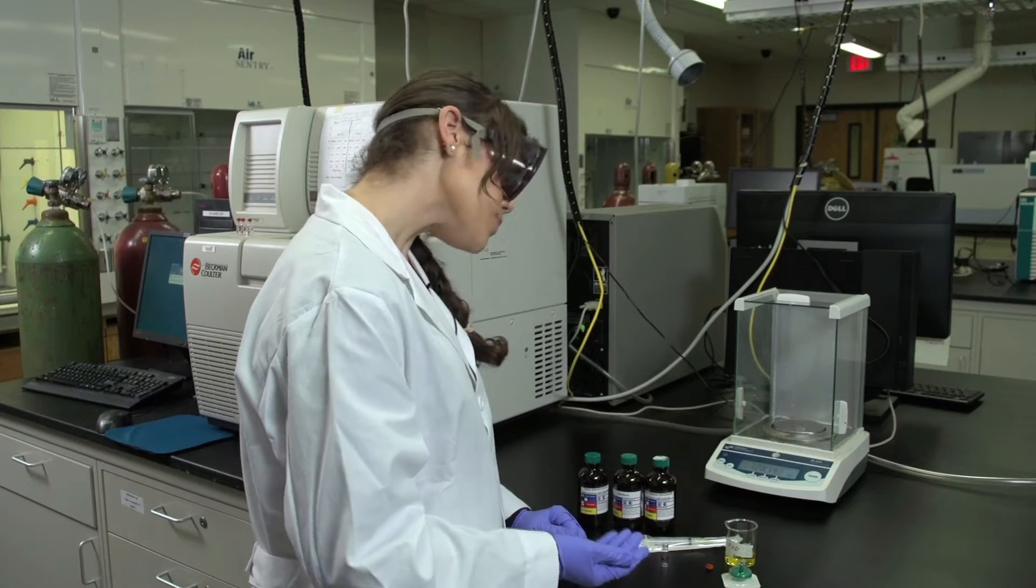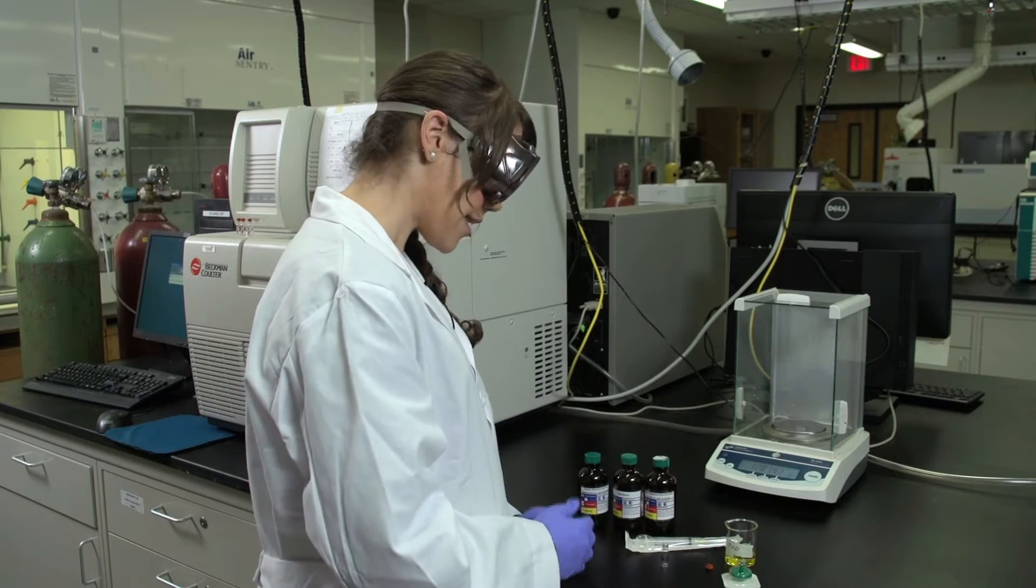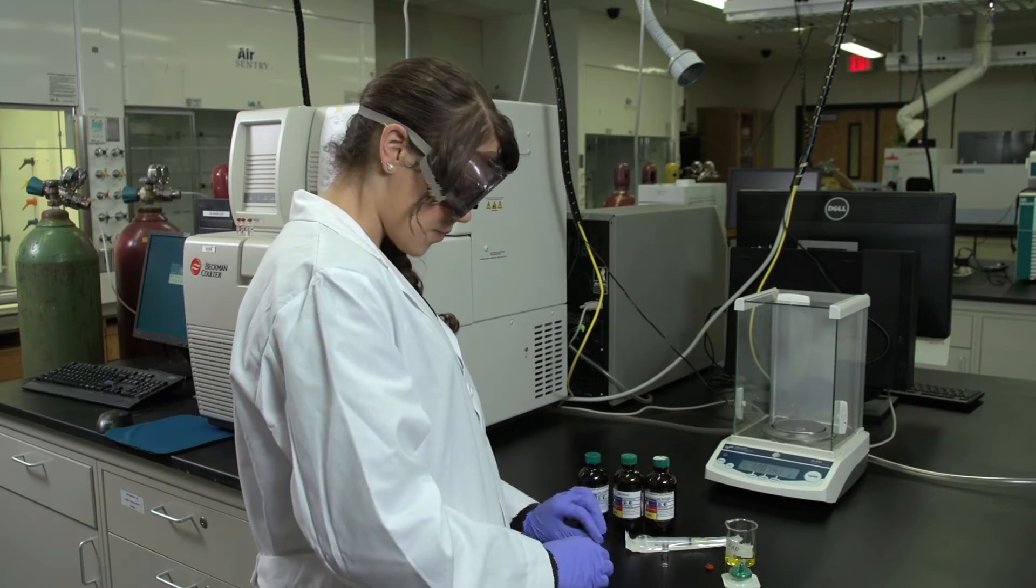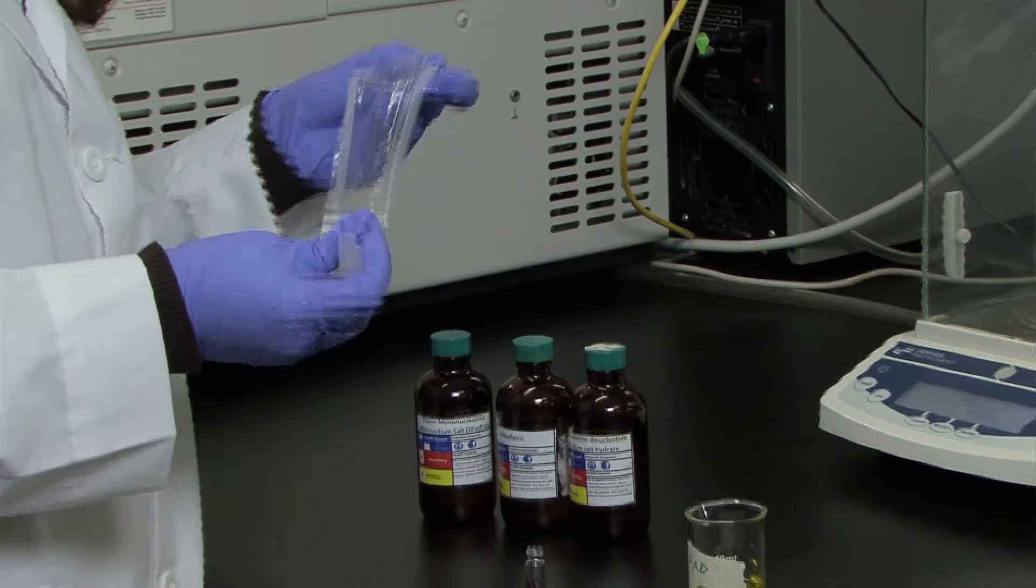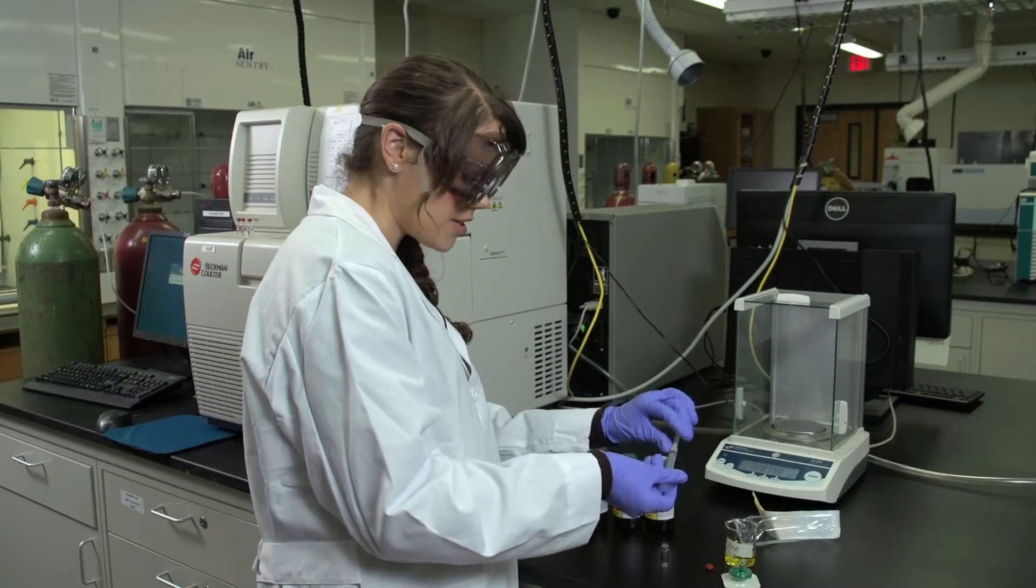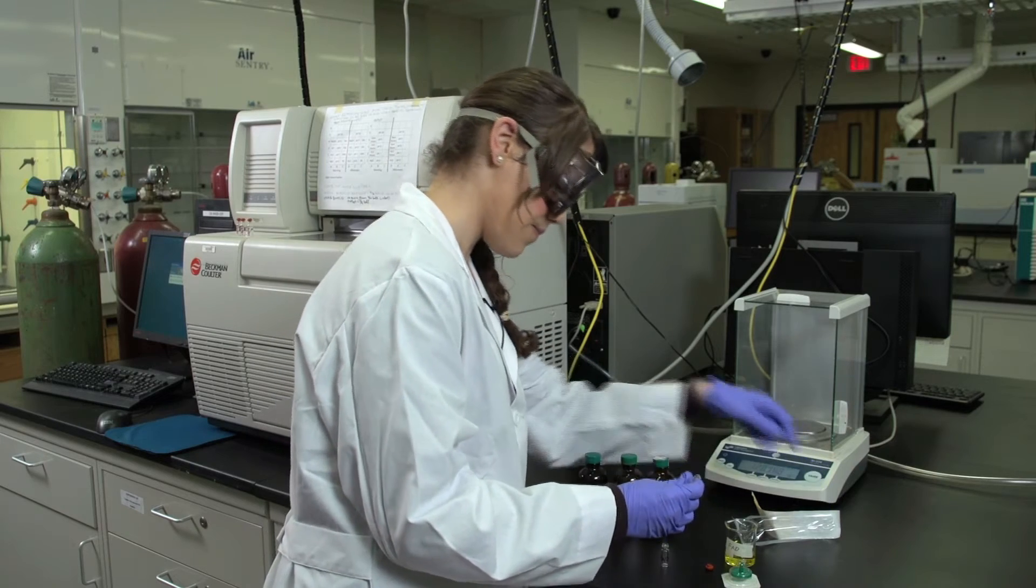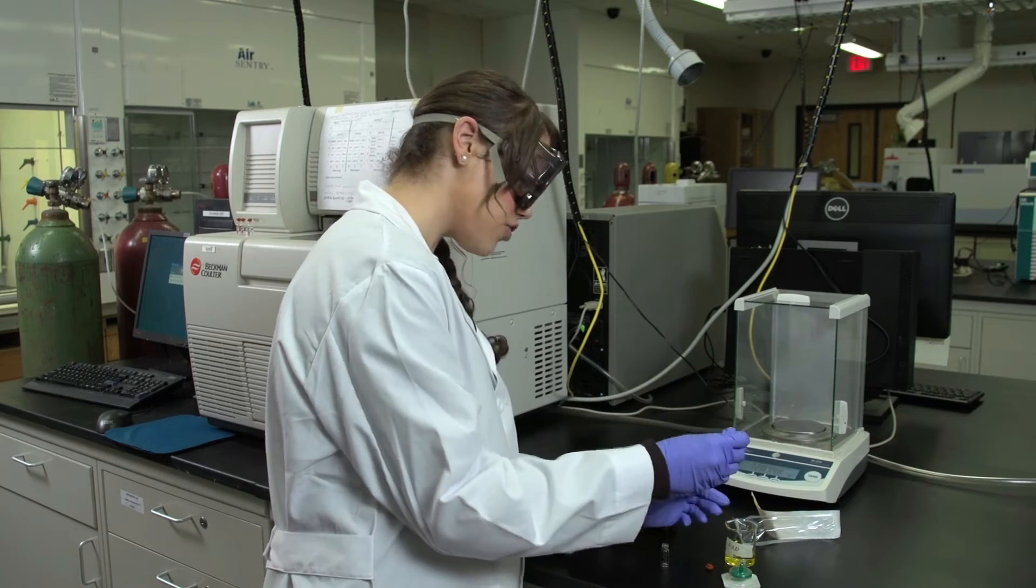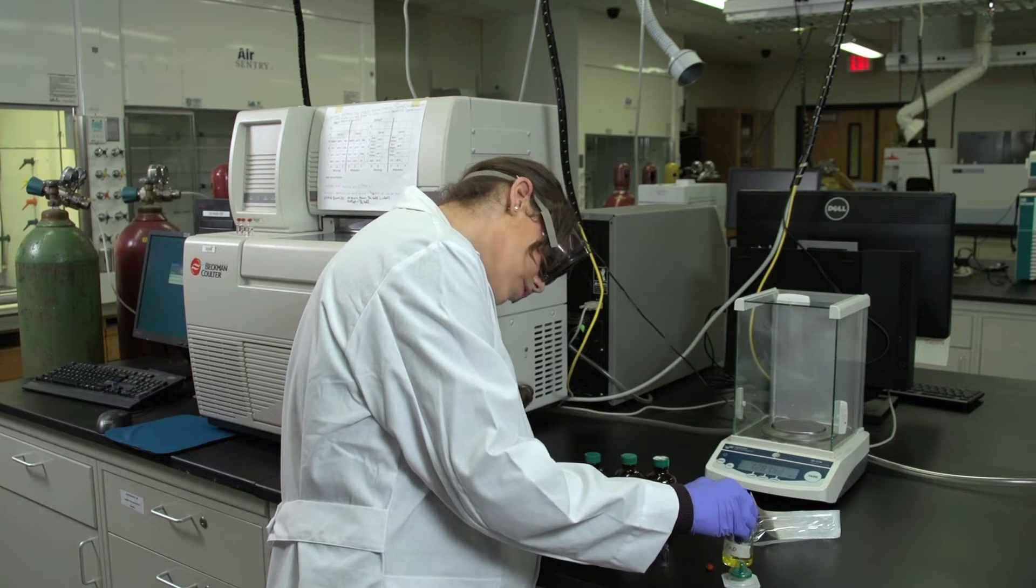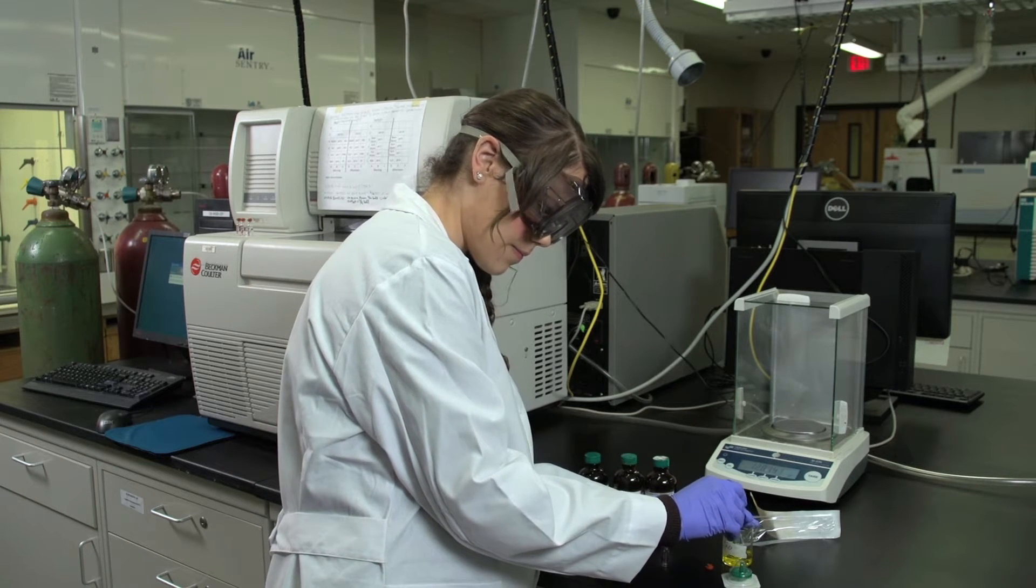So to prepare your solutions to be loaded into the capillary electrophoresis, you need to filter them. The first thing you need to do is open up the syringe. If there's a needle attached to it, you need to carefully twist it off to remove it. Then you can stick your syringe directly into your beaker with your solution to be filtered and slowly draw it up.